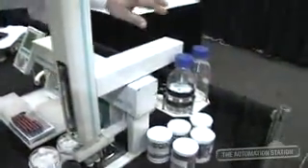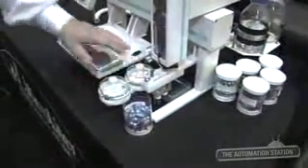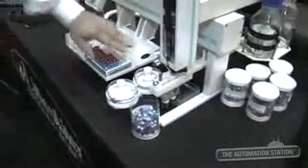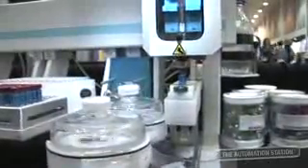What we're going to show you today is a single elution SPE method, where we use an HTC PAL from CTC Analytics. We will condition the device with these solvents back here, we'll have a waste location here where we'll move our device, and then we'll have elution solvents here. The idea is to pick this device up and move it anywhere on the platform to perform your conditioning steps, loading of your raw sample, and then your final elution and injecting onto the valve.